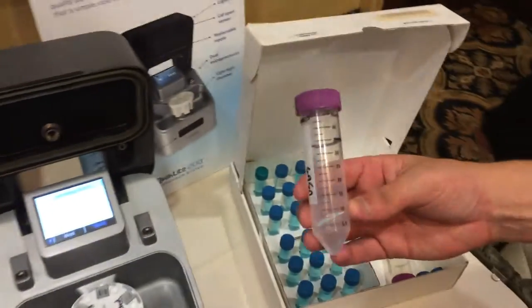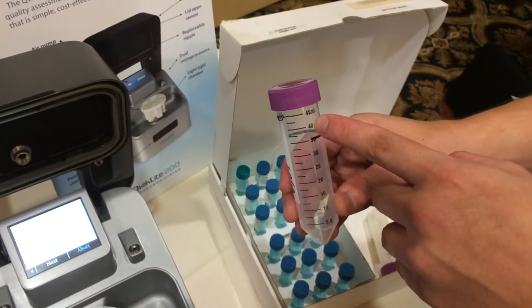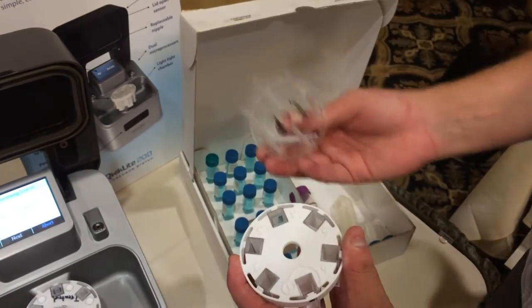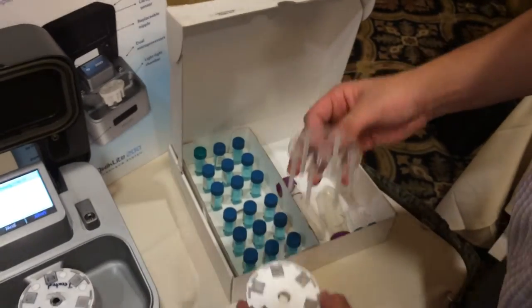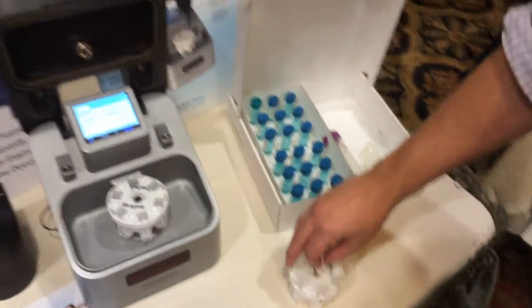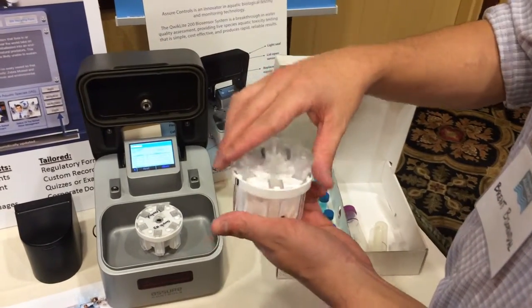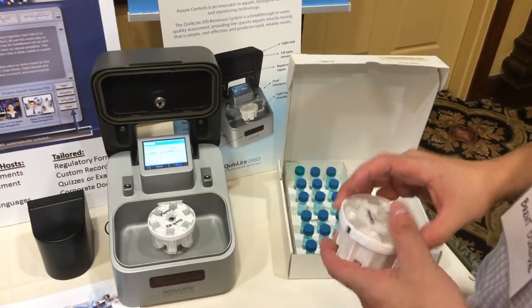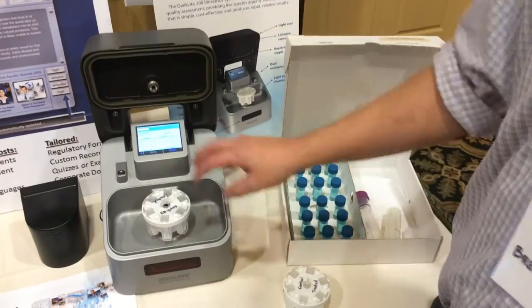Then you take your samples, which require 35 ml of your water sample. After that we add 5 ml of our plankton, and then they get dosed into this cartridge. That's where they begin their four-hour exposure period. Room temperature, or whatever your sampling temperature is, is fine for them. They get dosed up, put in here, and start their exposure period for four hours — 24 hours preferred.